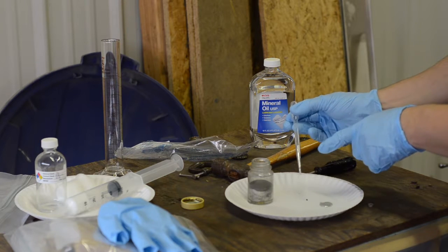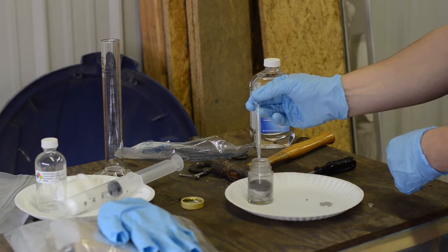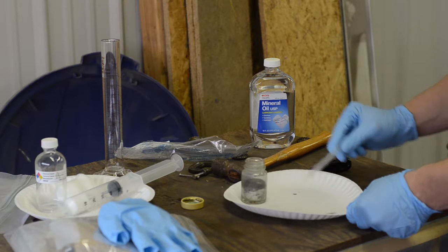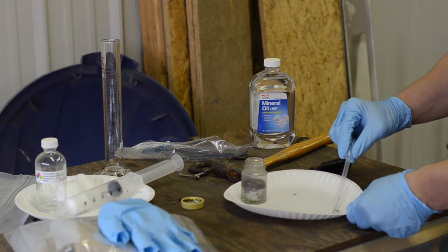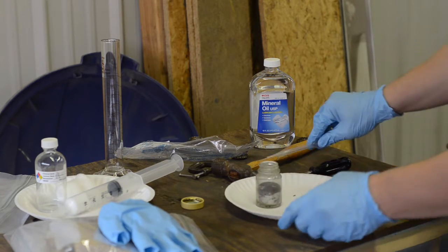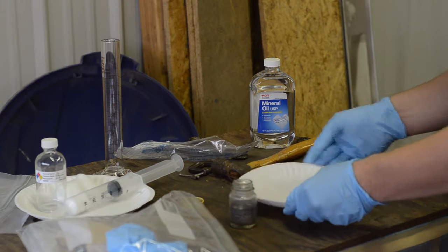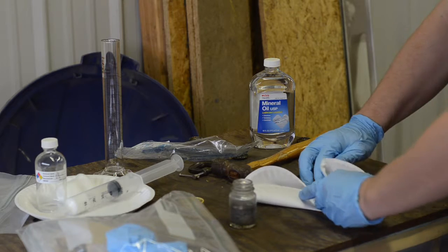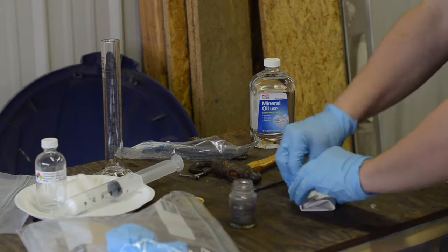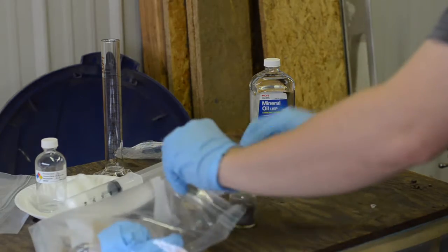It is amazing how heavy it is in this container. You can really feel it. And that is the last of it. And I don't have any small beadlets running around my plate anymore. So we will carefully fold all this up. Place it into the waste pile as well.